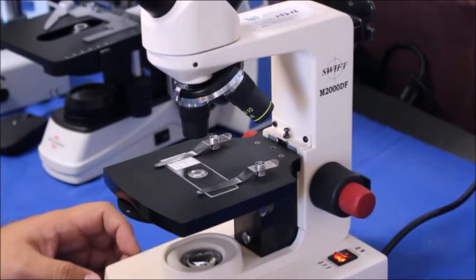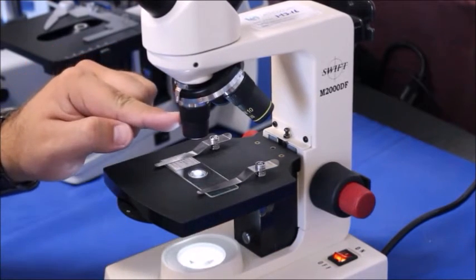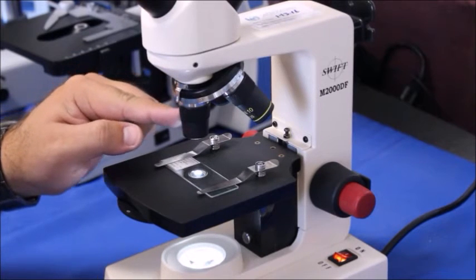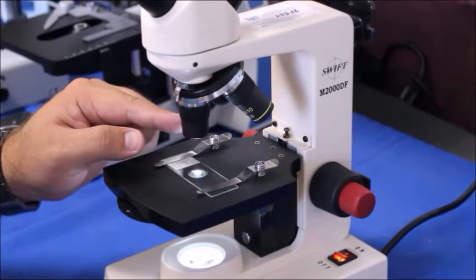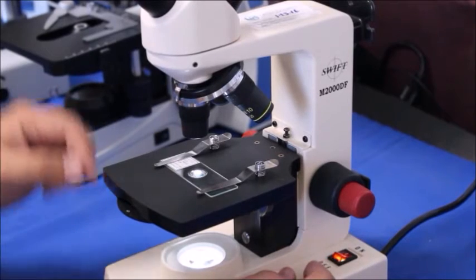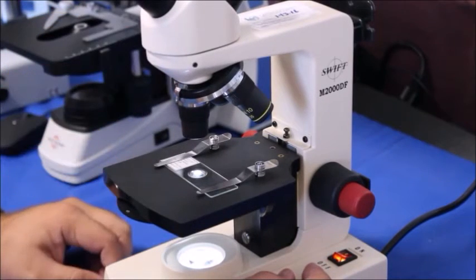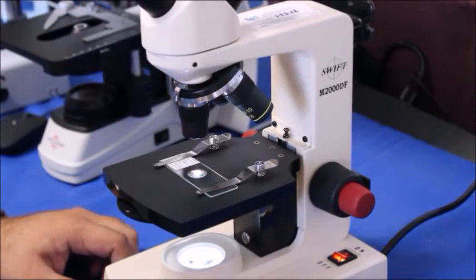We're going to start on the 4x objective, which is the smallest one, the shortest one, and the lowest magnification. It's going to be the easiest for us to work our way up from there. This one has two eyepieces, but for this video we're just going to use one. Doesn't matter which one you use.